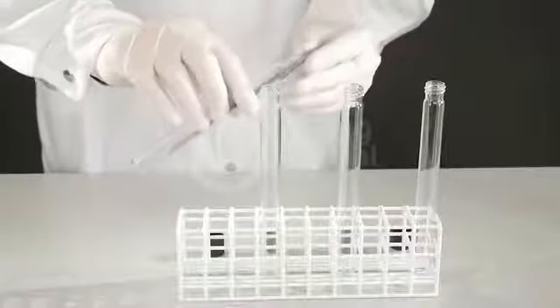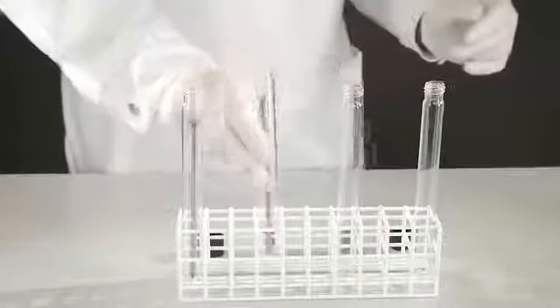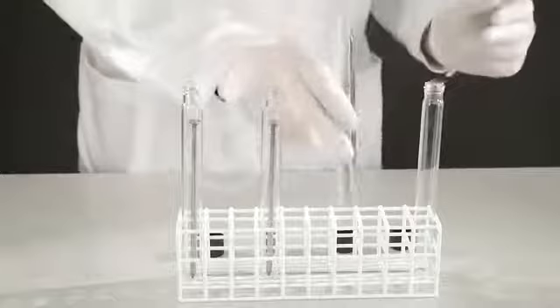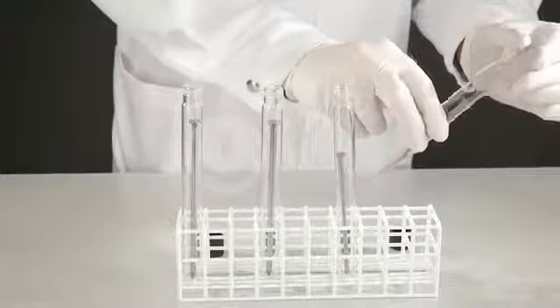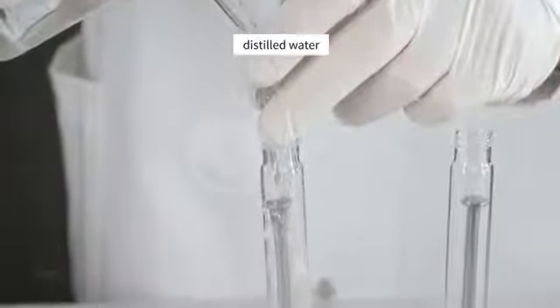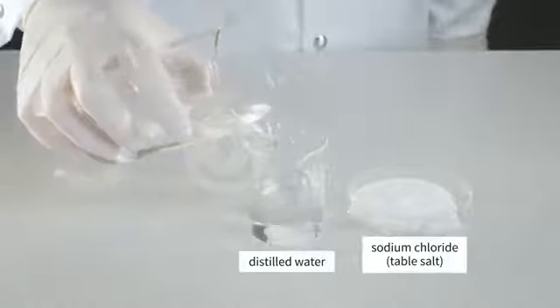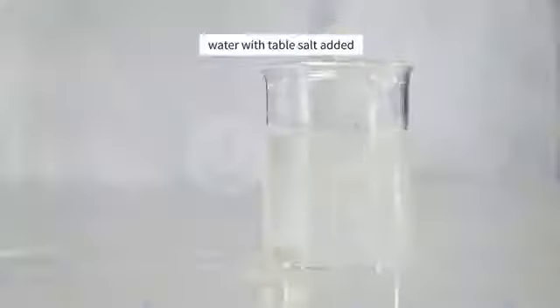We place nails in 4 test tubes. We add a little distilled water to the first test tube. We pour the water with some table salt into the second test tube.